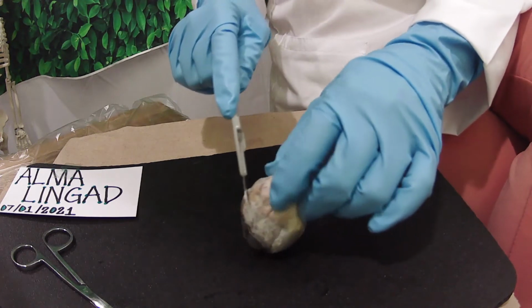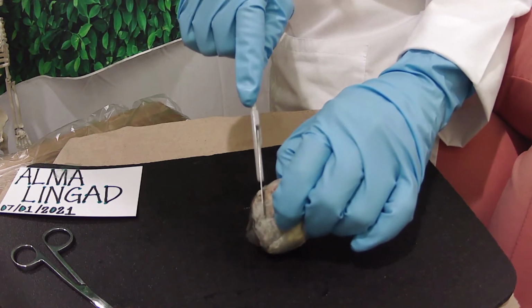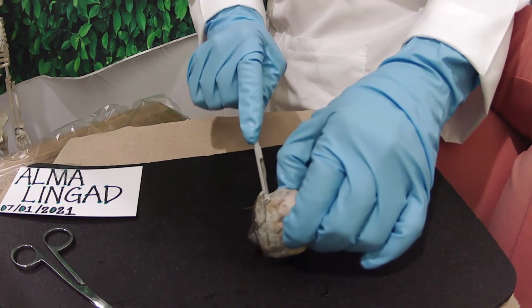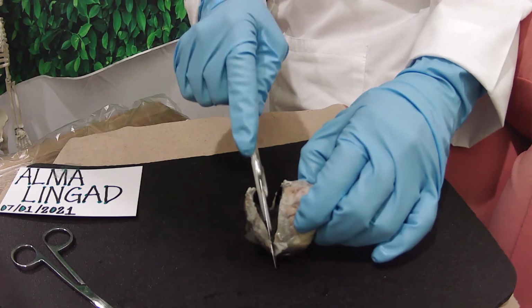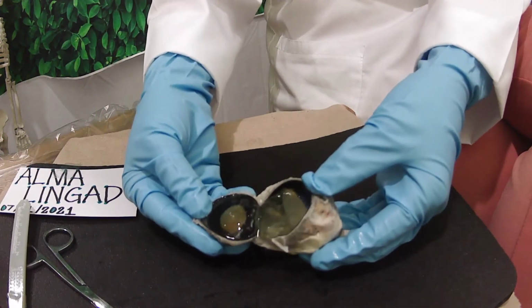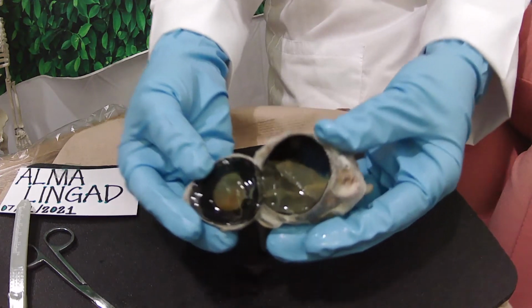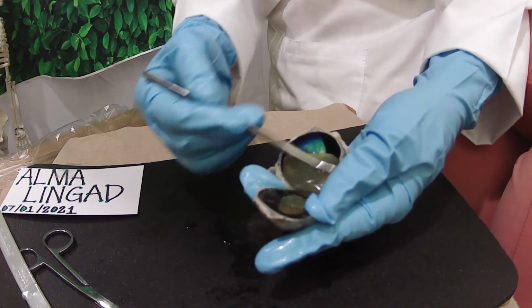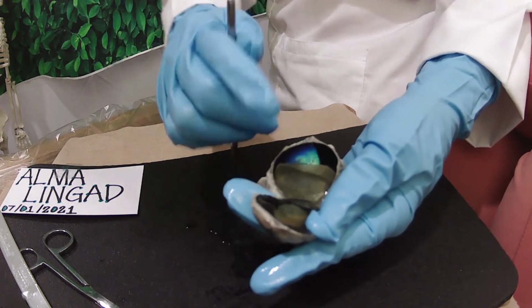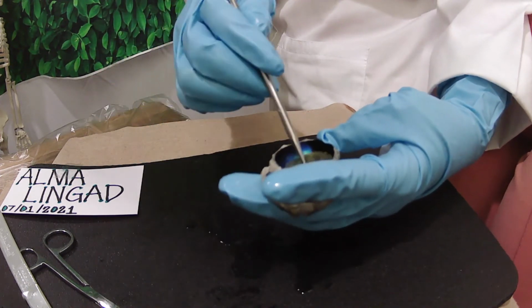Now let us cut the eye using the scalpel into an anterior and a posterior portion. Cutting downward. And it's going to look like this. This gelatinous portion of the eye is called the vitreous body. The vitreous humor is the posterior cavity, filled with more viscous fluid. As you can see, it is gelatinous type.